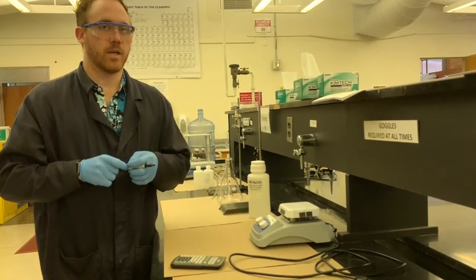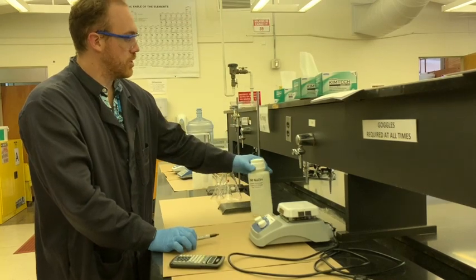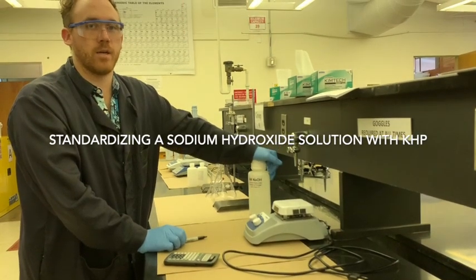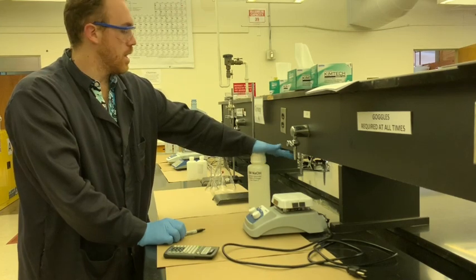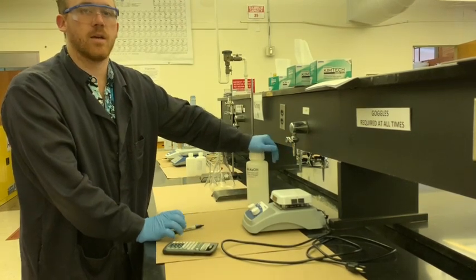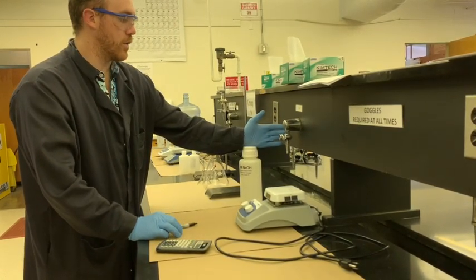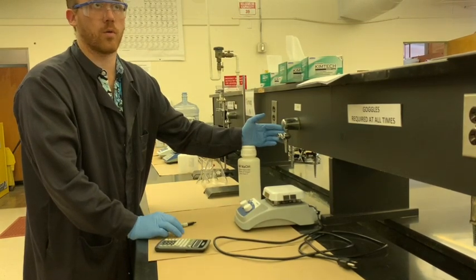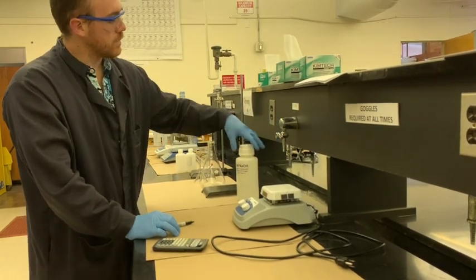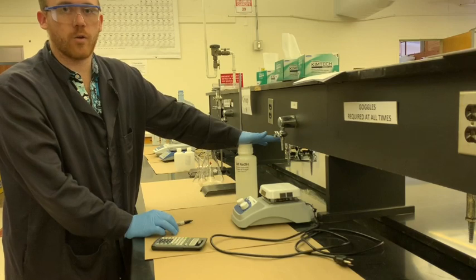So the NaOH that we're going to be using is going to be diluted from 6 molar NaOH. And we have a pretty general idea of how concentrated it is, but 6 molar is pretty vague. What we're going to use is the solid form of KHP, which is also known as potassium hydrogen phthalate. And that's going to be weighed out. Weighing it out will allow us to use all of the significant figures that you can hopefully get from a scale, depending on how precise it is, to figure out exactly how much of that compound per mole or per gram is in that sample. And you're going to have a few different samples to get an idea of what the concentration of the NaOH is through titration. So that sounds like a whole lot of information. We're going to go through that step by step.